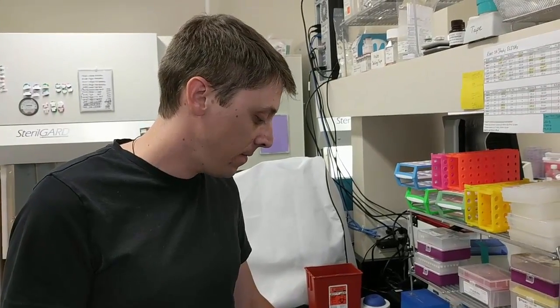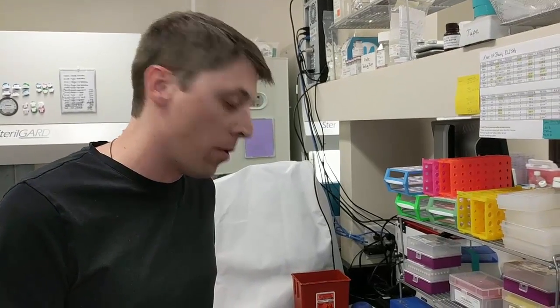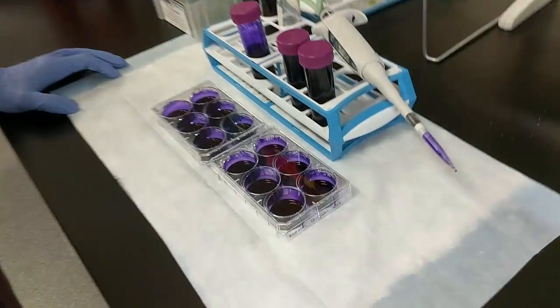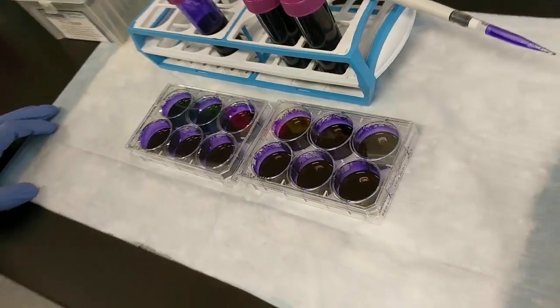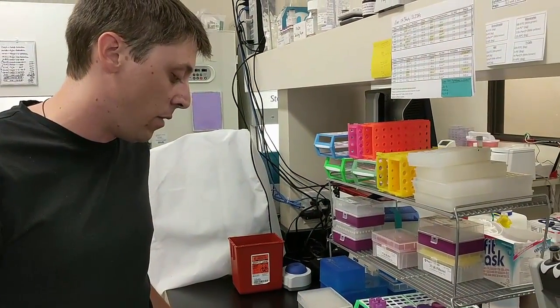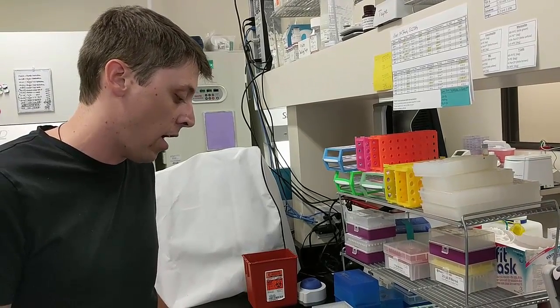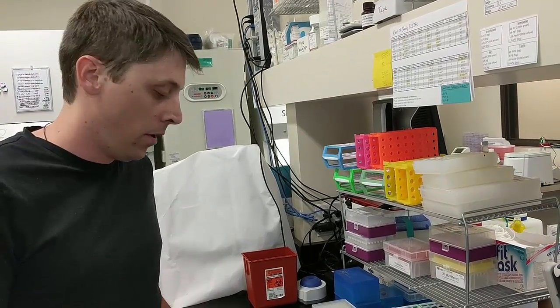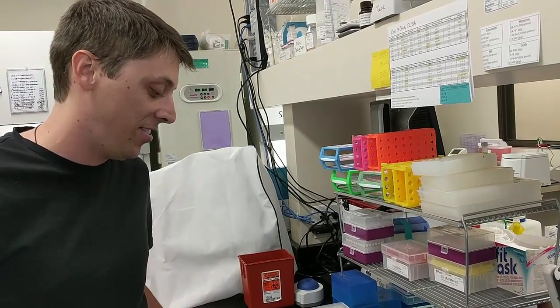He's going to tell you what he's doing here with CFUs. What I have currently is two culture plates that I've seeded with buffy coat concentrate. What we have done is cultured them out for a period of 10 days after plating at low density. I'm currently staining them with a dye called crystal violet. This dye will stain any cell on the surface a dark purple in color.